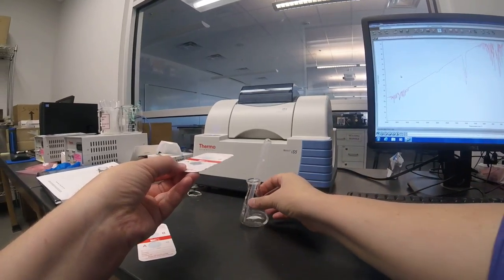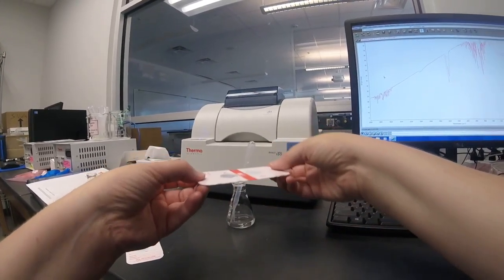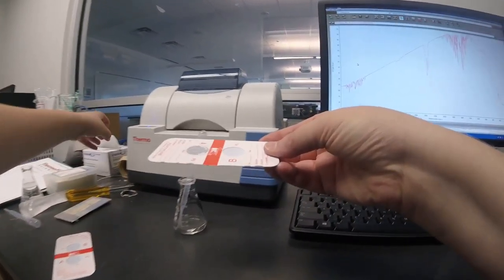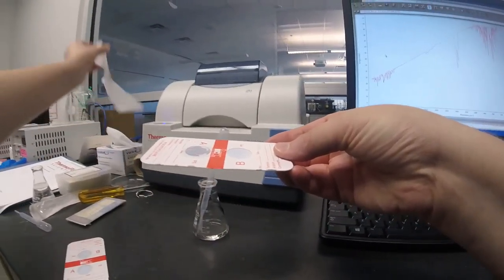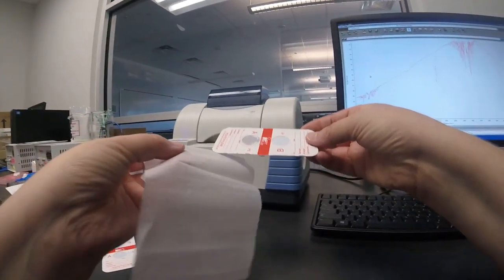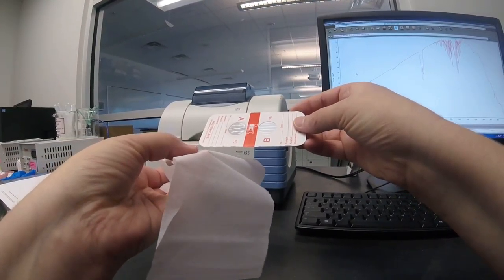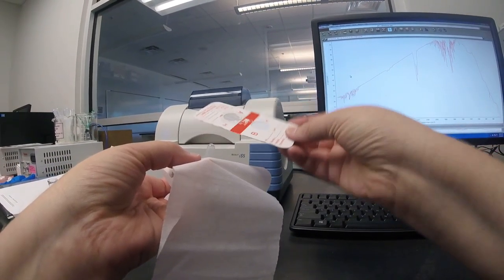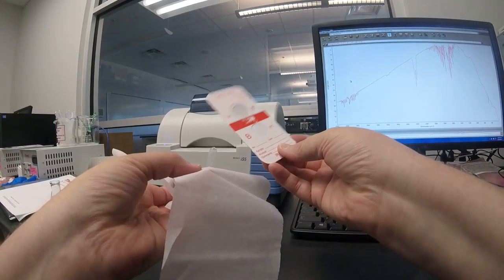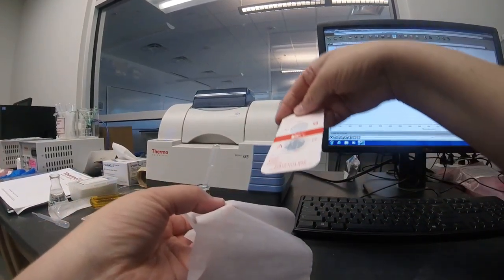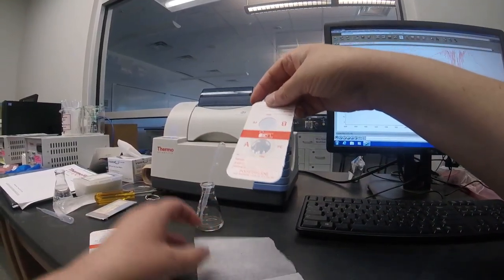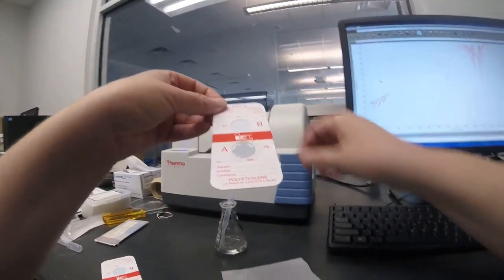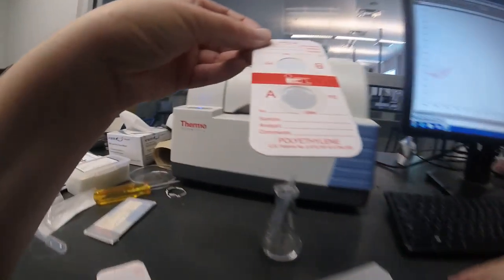If you get too many, like I probably just did, you can come over and drop a kim wipe and wipe it off. Actually that's looking pretty good. It's not important that the sample card is entirely inundated, but it's nice if it is.